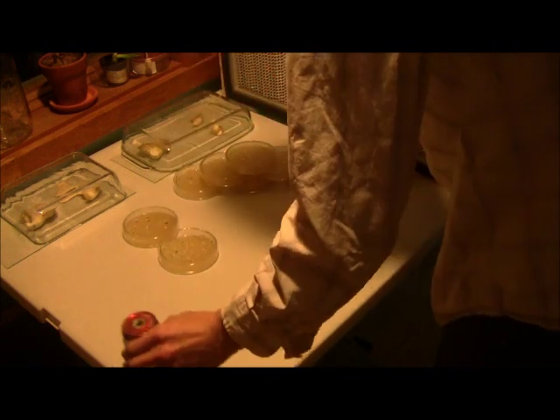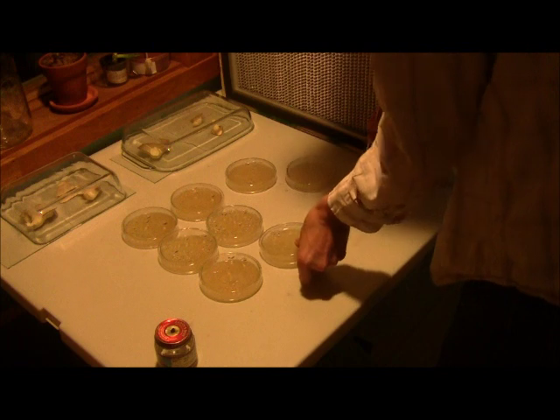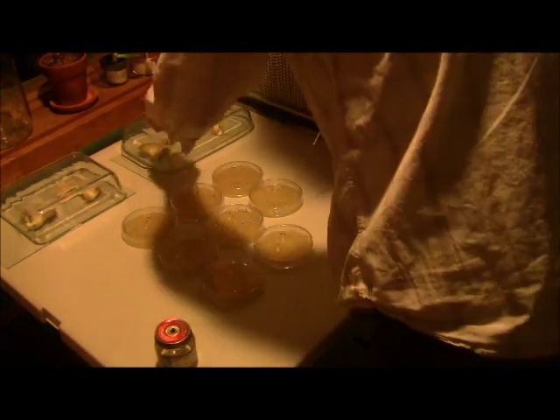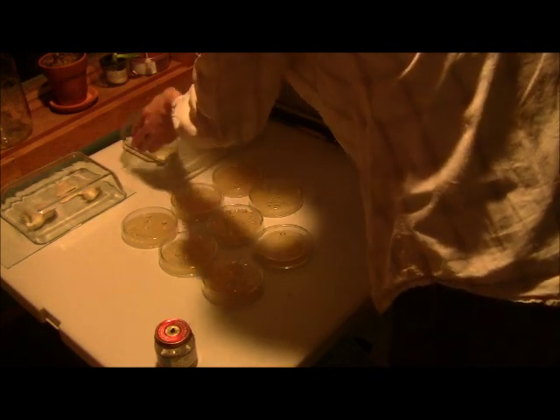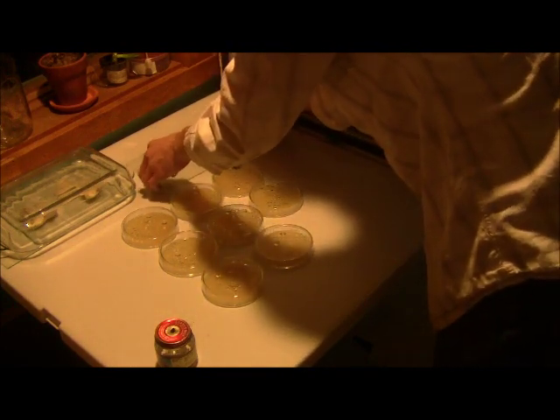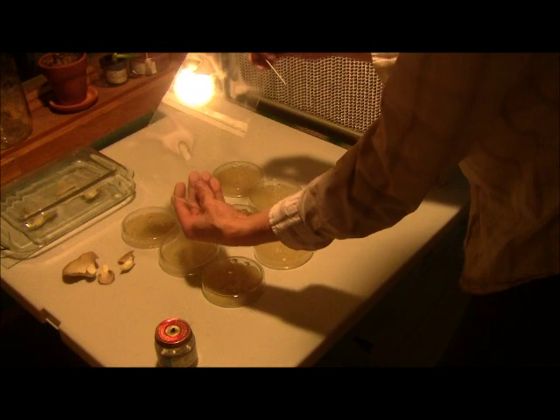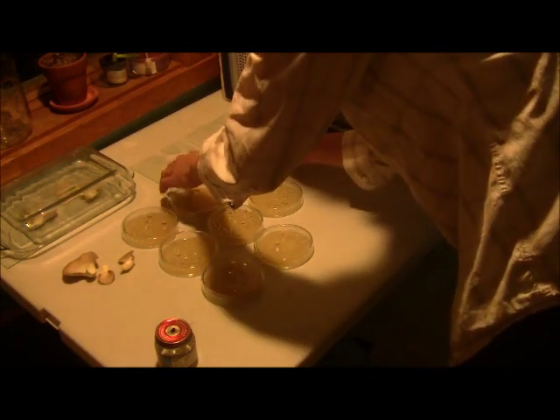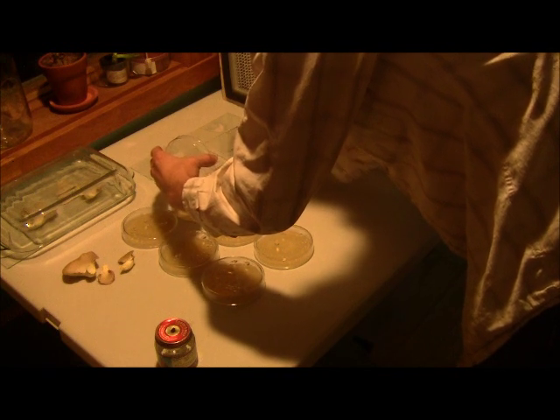There's definitely condensation inside the petries as a result of pouring the agar. We don't need all of these to be perfect — we just want a couple that are as healthy as possible. We'll most likely end up with a couple that get contaminated. I'll go ahead and start here. It can't hurt to diversify. There's a pretty good spore print here — you can see it's a beautiful print. I've used some of the condensation to pick up some of these spores.